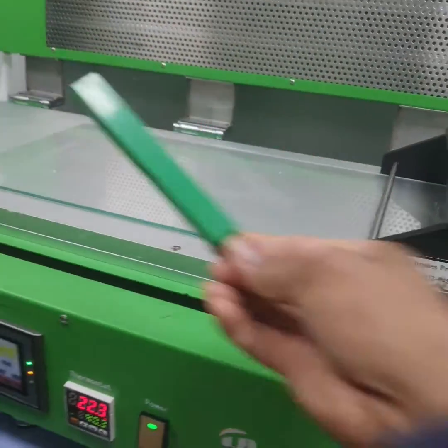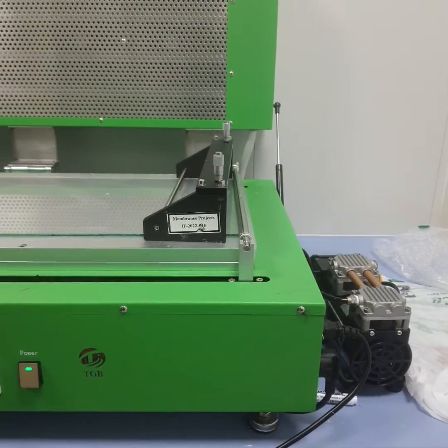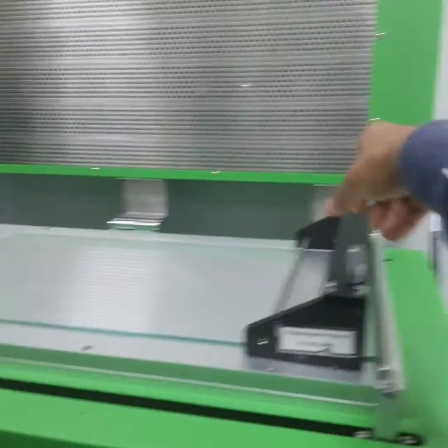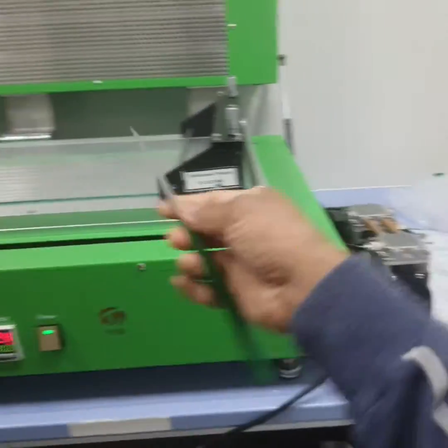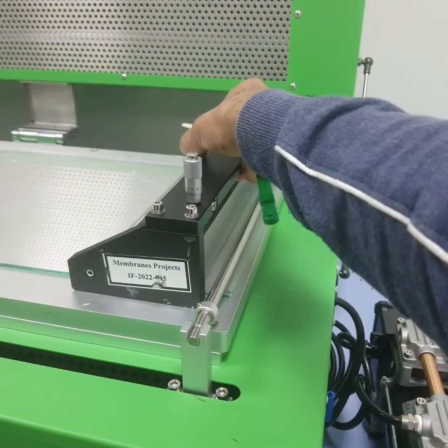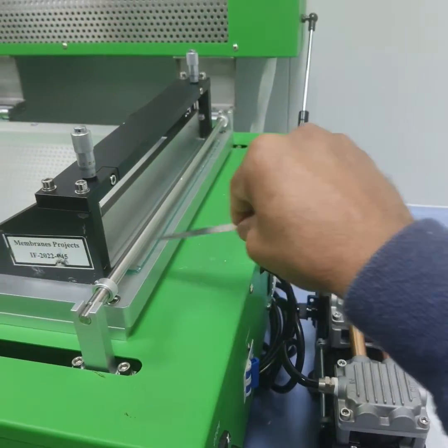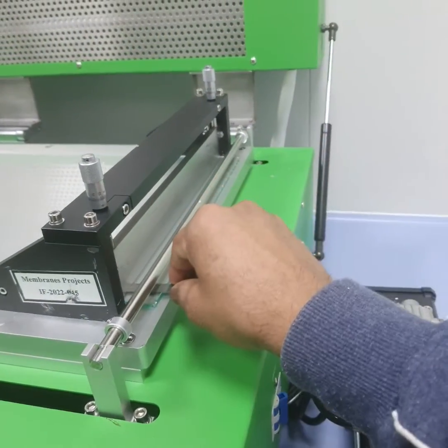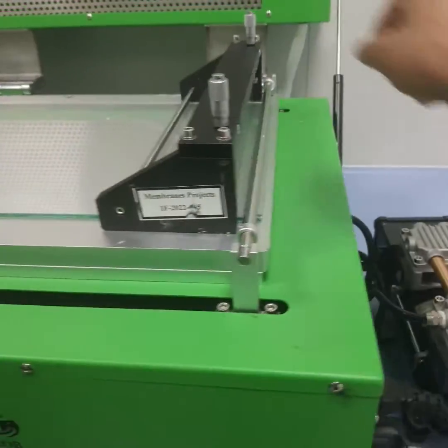Can you open the scales? Set 0.2, take out 0.2. You need to set the exact value using these levers. So this is 0.2. Now let us check, is it really 0.2 or not? I think this is okay. This is fine. Now, after that, can you bring your assortment, please?